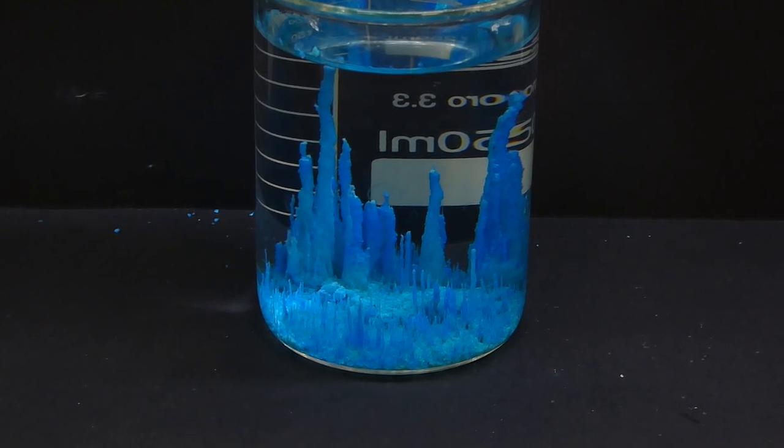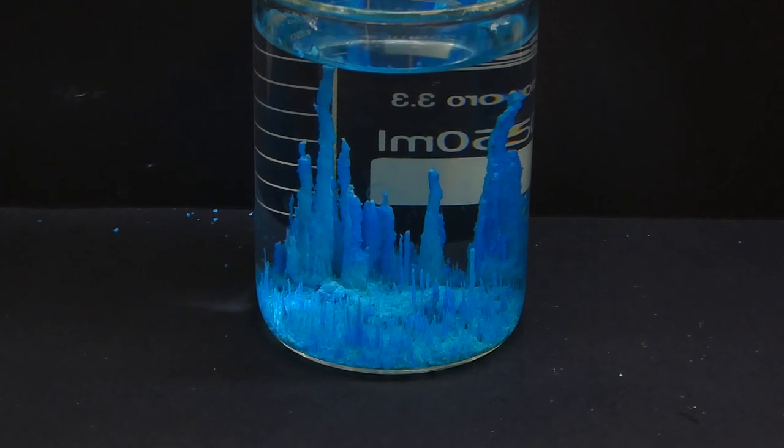In the example you see here, the reaction takes much longer than usual because I did something wrong with the concentration of sodium silicate, but in the end it turned out ok.